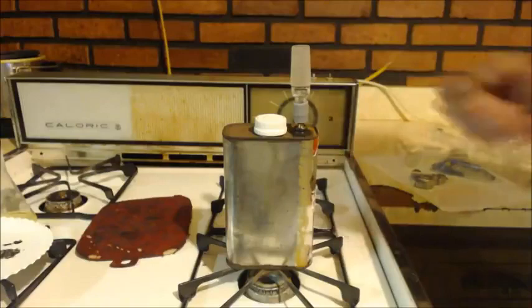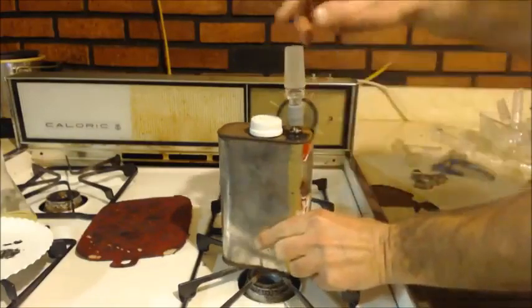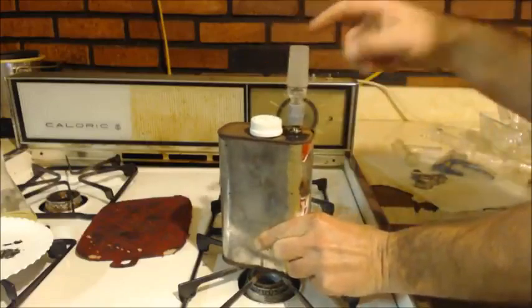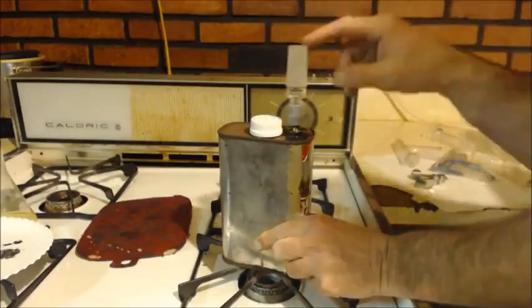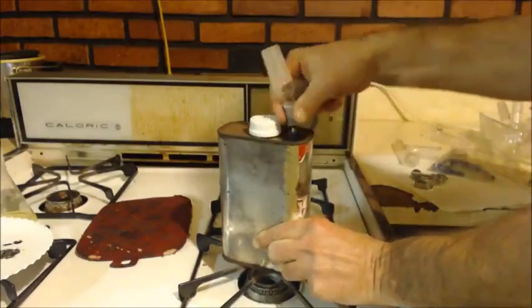Plus, this is very flexible because it's just this gasket holding this on. See what I mean? Very flexible. Look at that. You can take it off easily or whatever. You can see it's starting to get water up in there. Not quite up to the top. Oh, it might be a little too high.